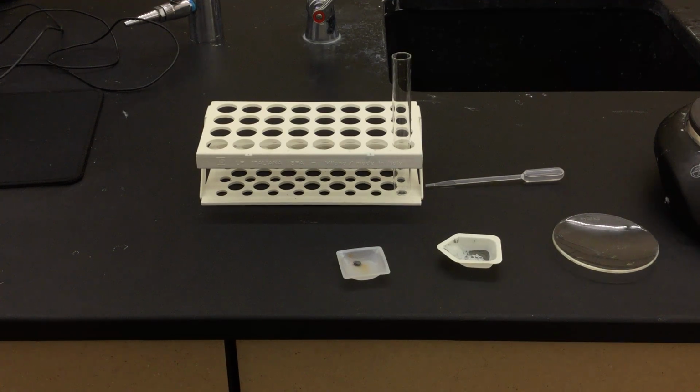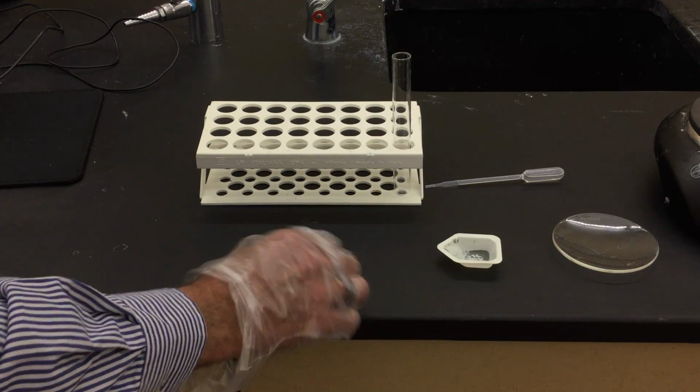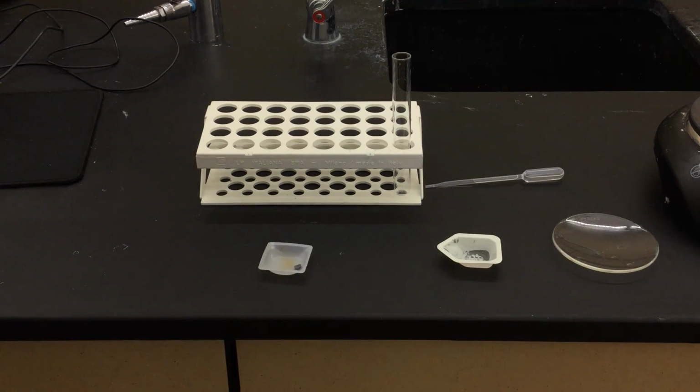Solid iodine, so here is our iodine right here that you can see. It's sitting in this tray. It's actually discoloring this tray, and it's actually slightly toxic, which is why I'm wearing gloves. And you can see what would happen if you were to touch it. That orange would go right into your hands. This is actually a non-metal. And we're going to be mixing this or dissolving this in some alcohol.